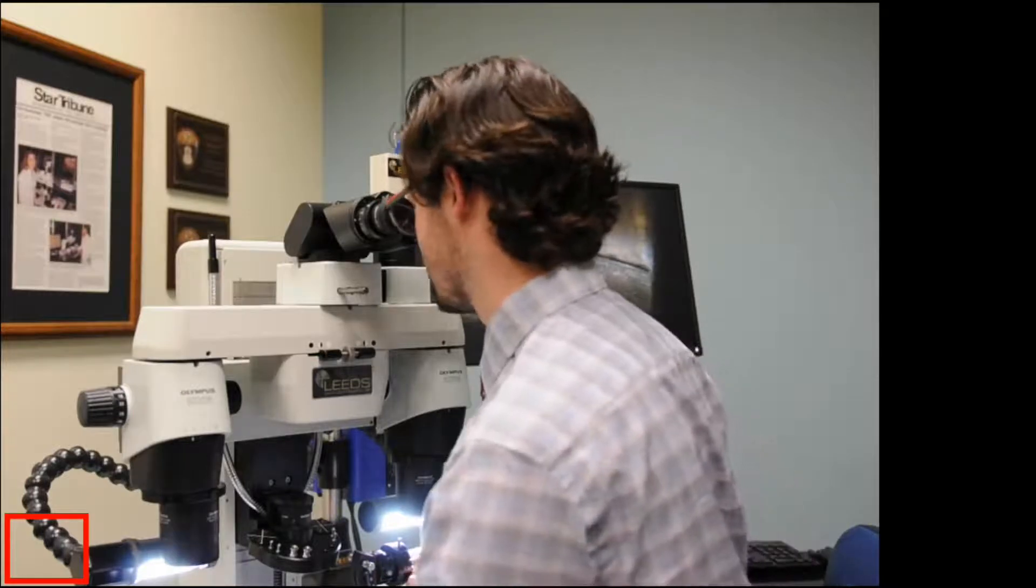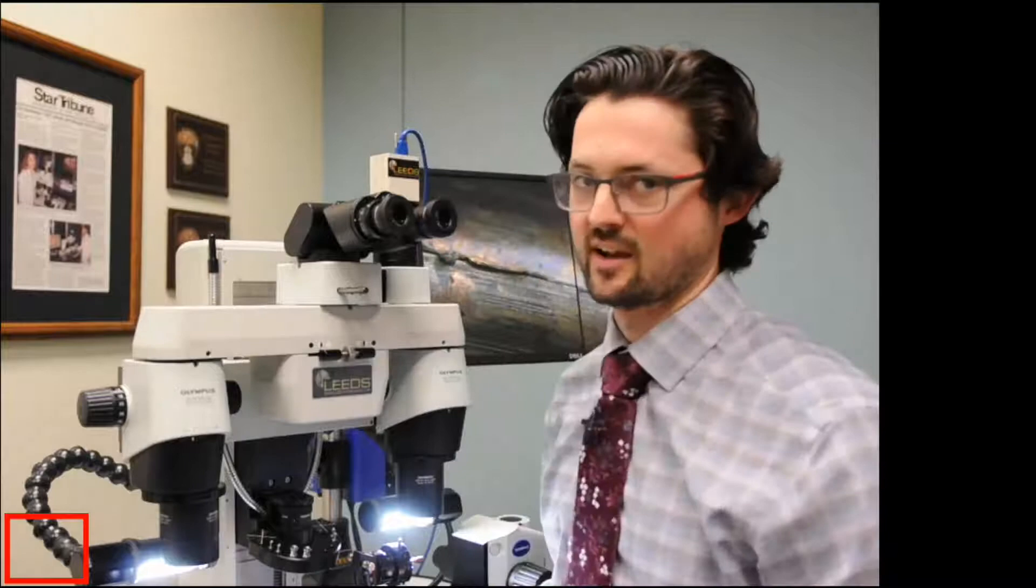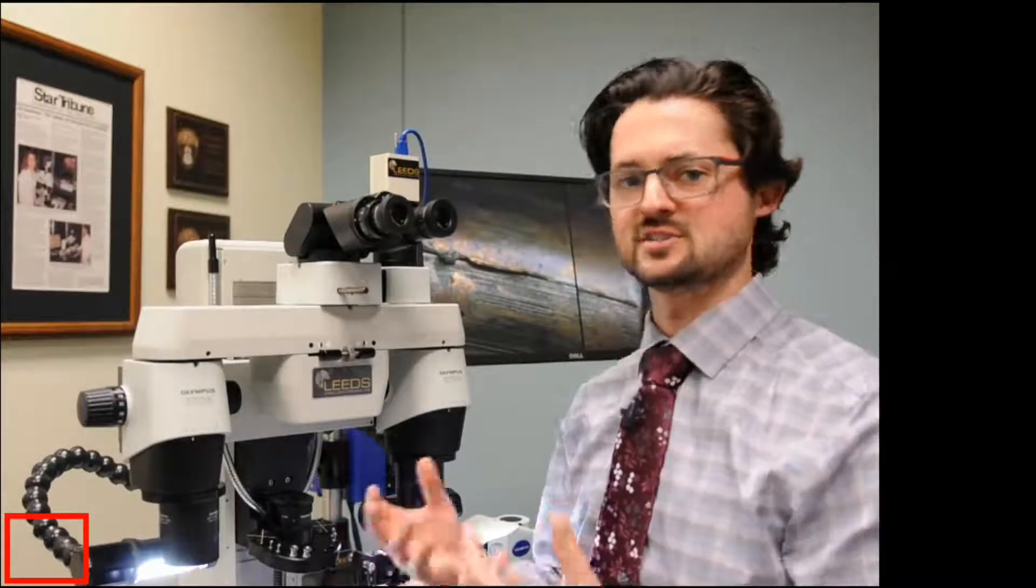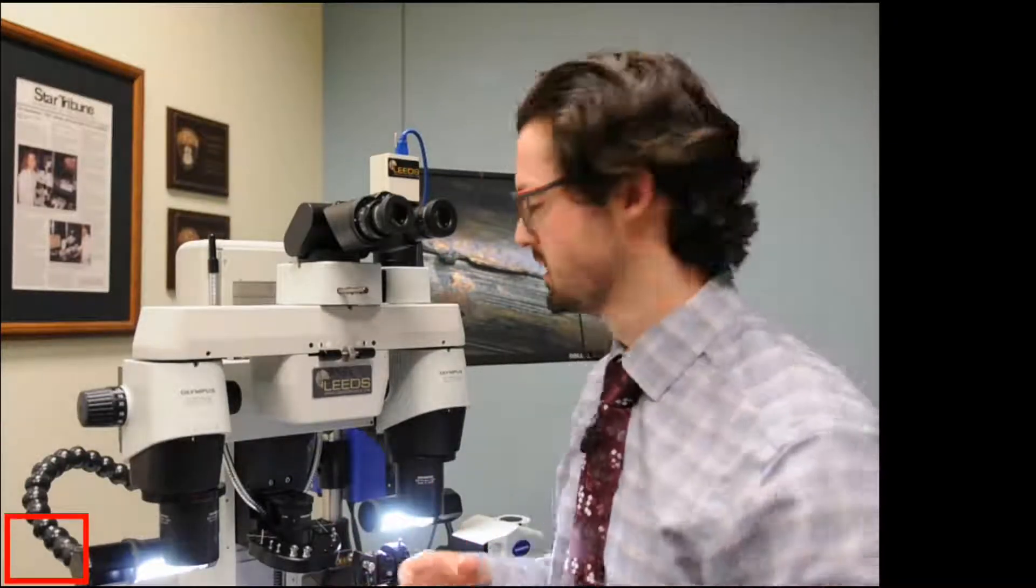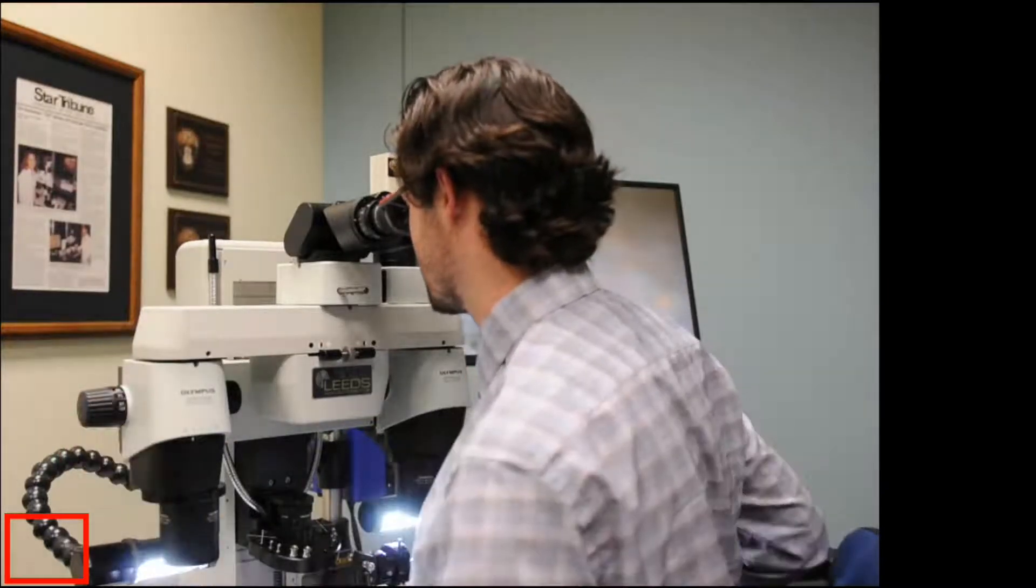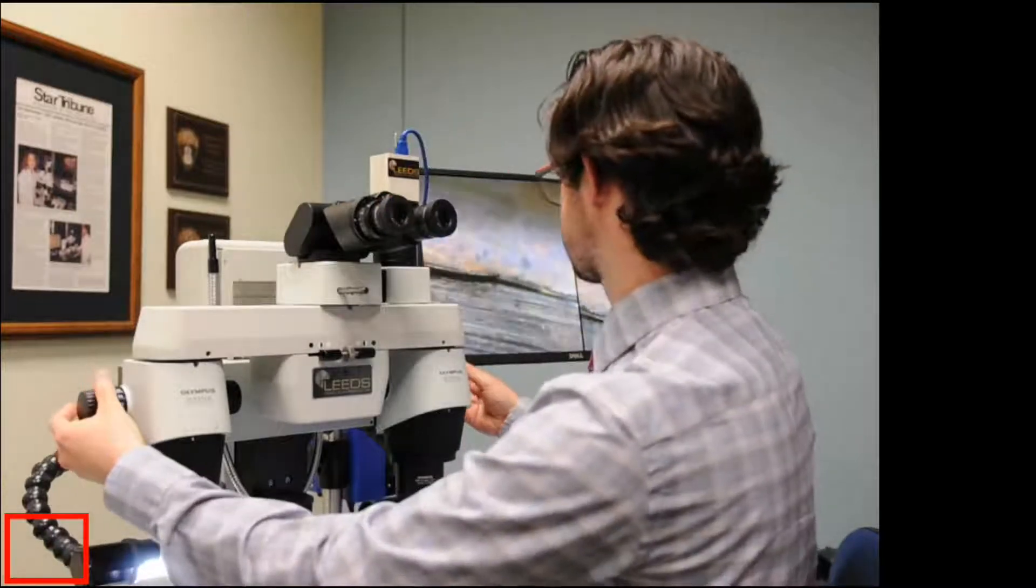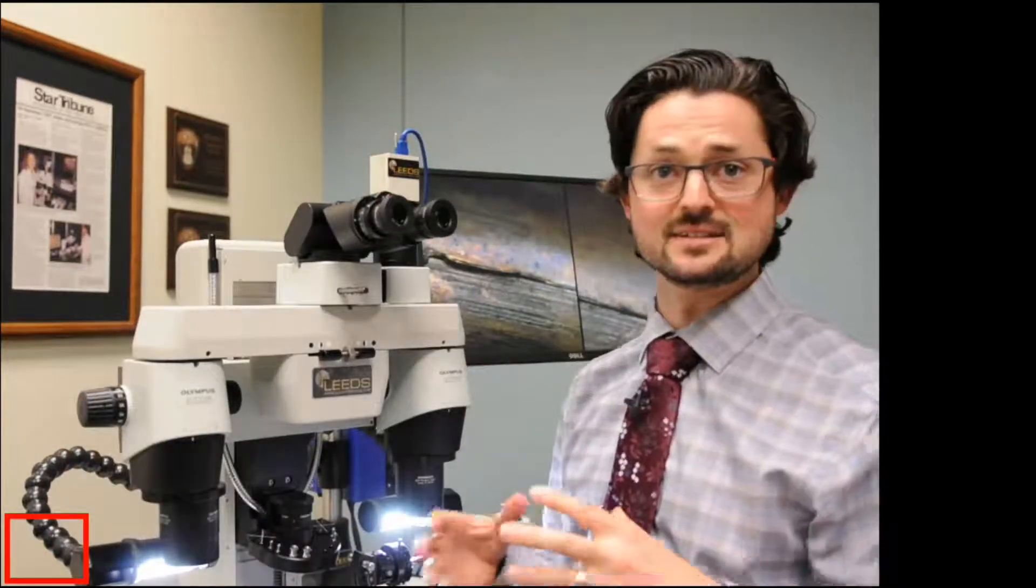And what's kind of neat with that is once your diopter numbers are set, if you find yourself kind of doing the focus dance, am I in focus, am I out of focus at low power, you can always just move up to a higher power than what you're at, adjust the focus, and then when you zoom out, the area that you're interested in is going to be in focus.